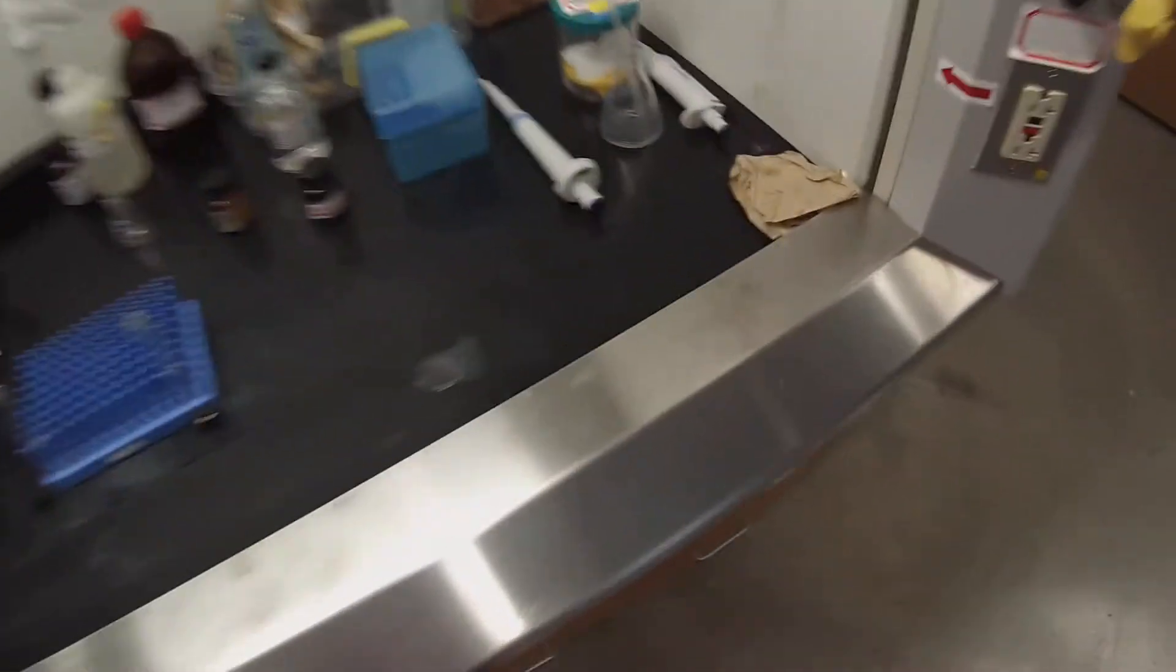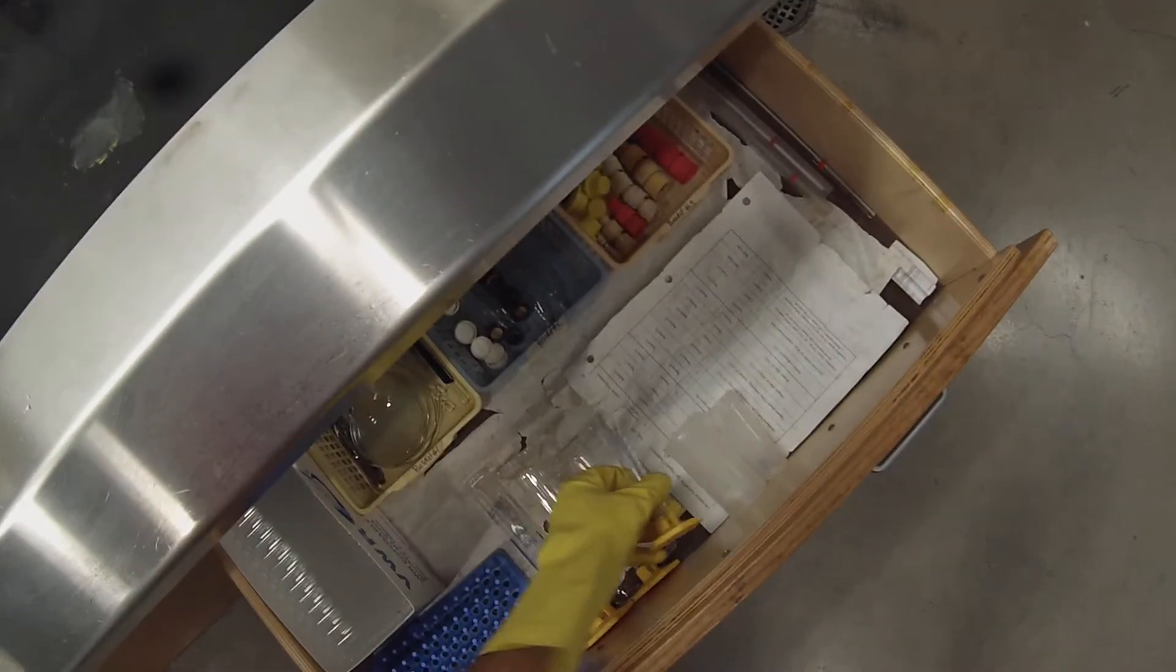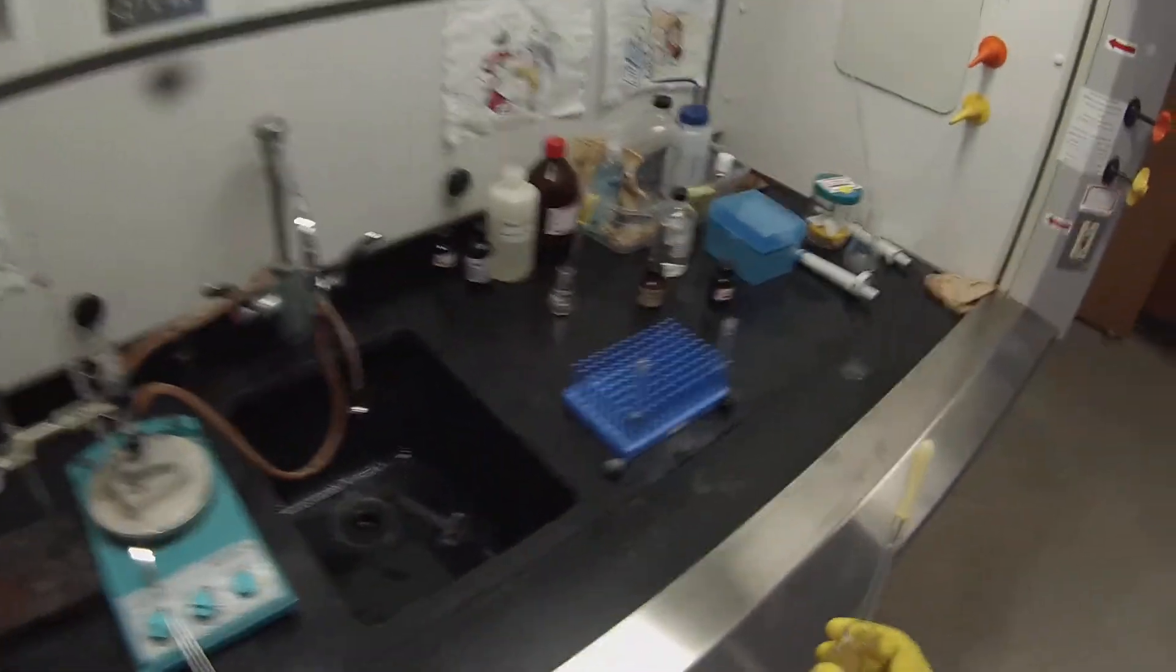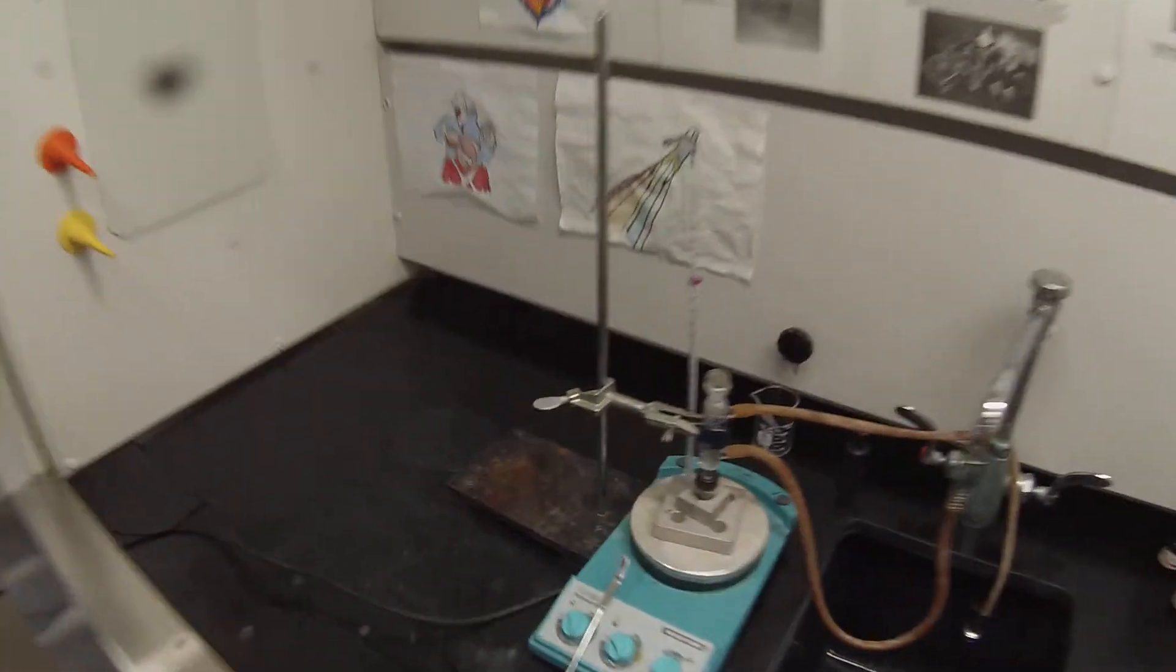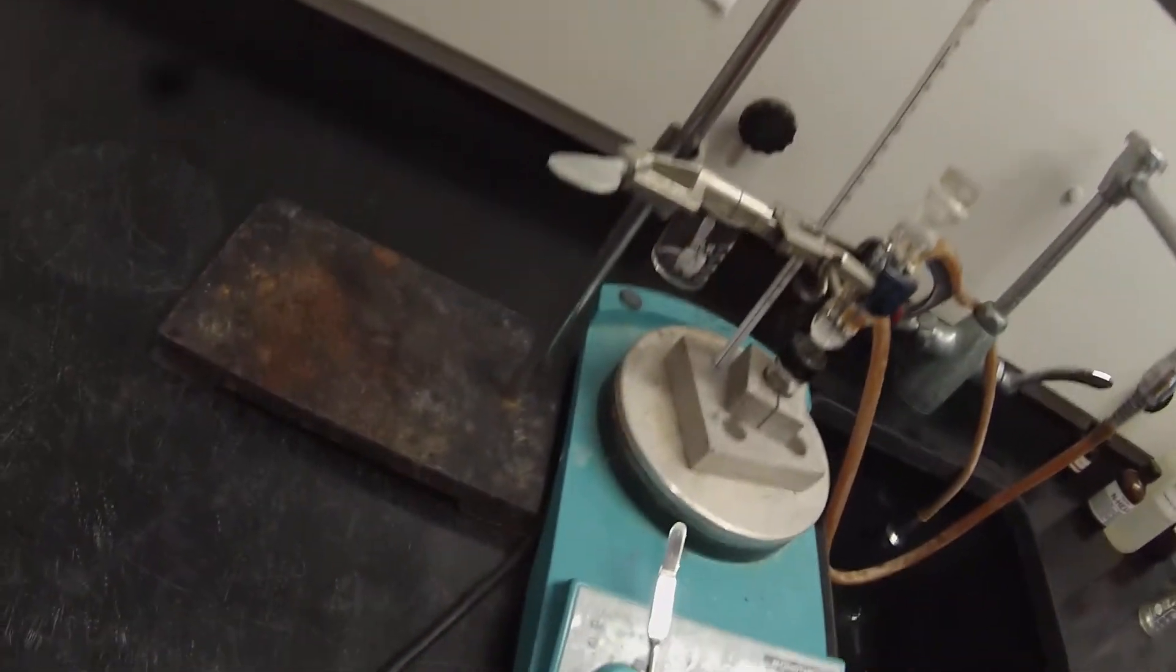There's no need to wash this. It was just a volatile solvent. I'm just going to shake it out a little bit and put it right back. And get another little Erlenmeyer out to hold that because I'm going to need that pipette to transfer the top layer into my conical vial. And we've got down a little lower than 140. I'm going to tweak that up just a little bit. Reflux is kind of stopping.